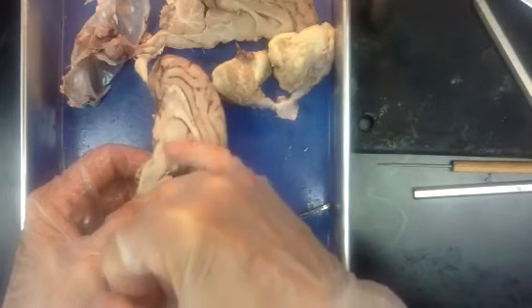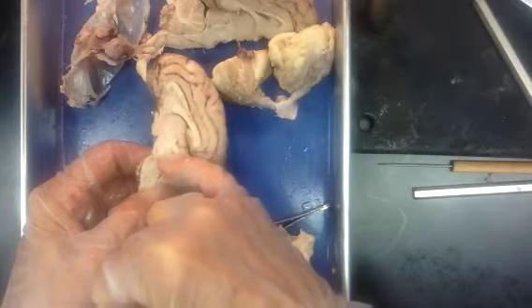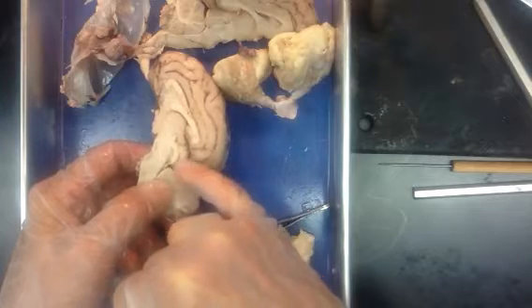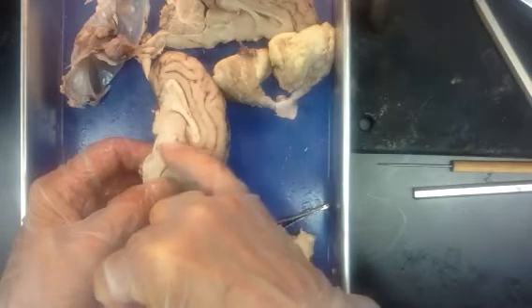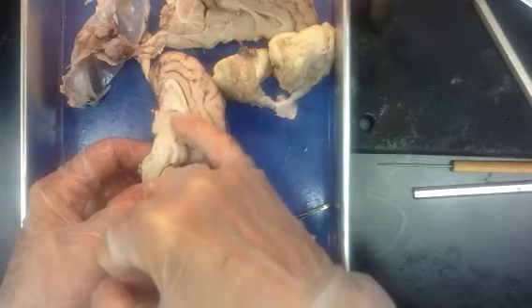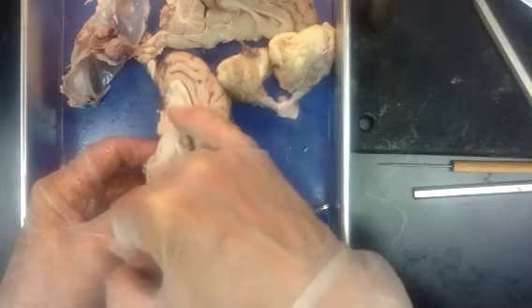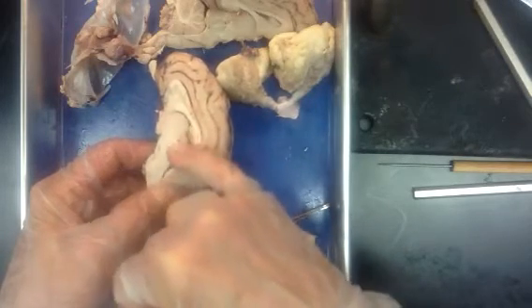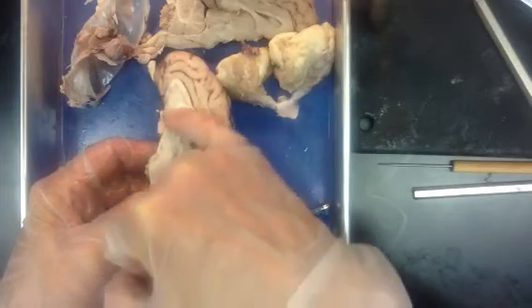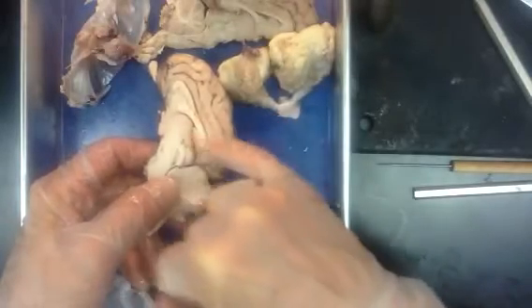This is involved with relaying sensory information, and it's particularly involved with hearing and visual reflexes. Then we're going to move up, and you'll see a round or oval, a little bit darker structure at the top of this brainstem called the thalamus. That's the final processing relay station. All information coming from the body goes through these structures and ultimately through the thalamus and is relayed to whichever part of the brain it needs to go.